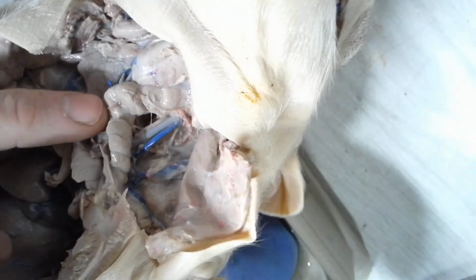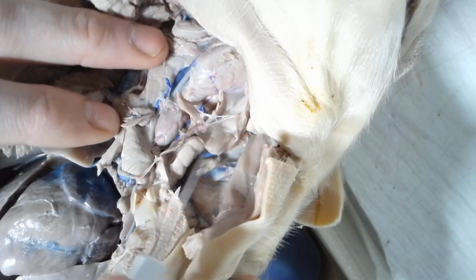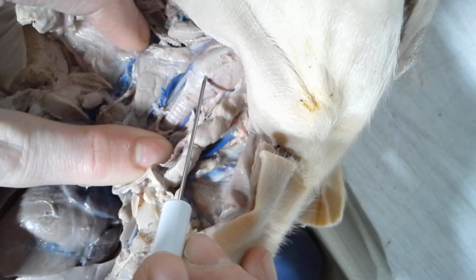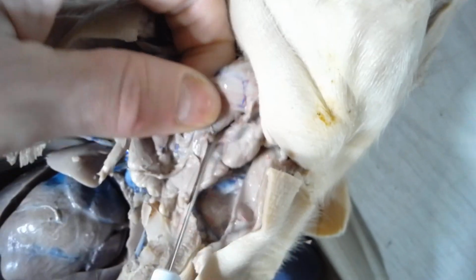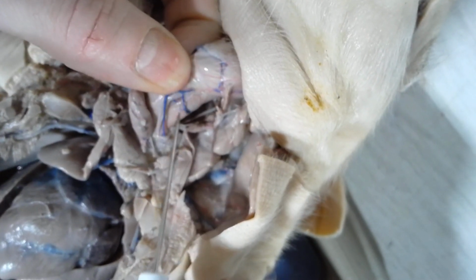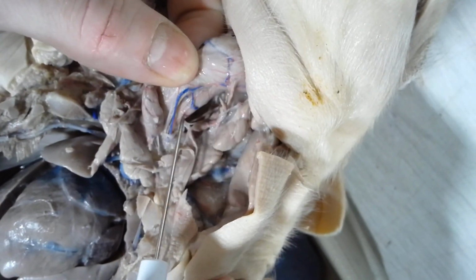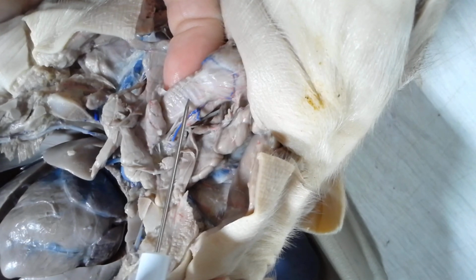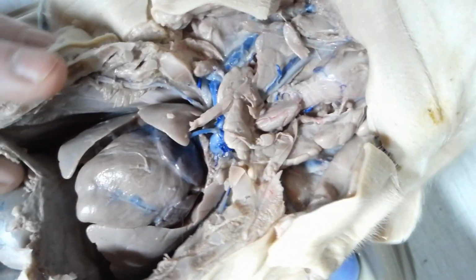Alright, so again, looking at the glands here, moving it to the side. These are the thymus glands on the side, thyroid right in the middle, respiratory structures, larynx, trachea. Now behind the trachea, if I pull this, there's a very flexible tube right directly behind the trachea here. This is the esophagus. This is what leads to the stomach. So it's a very flexible tube. So esophagus is behind the trachea. Alright, so those are all the structures of the neck. Moving on down to the chest.